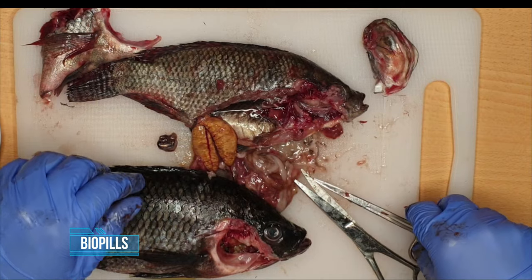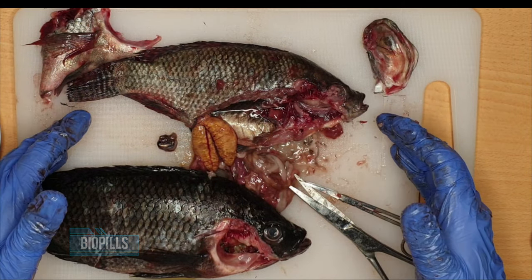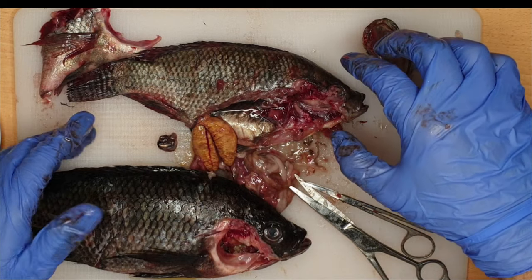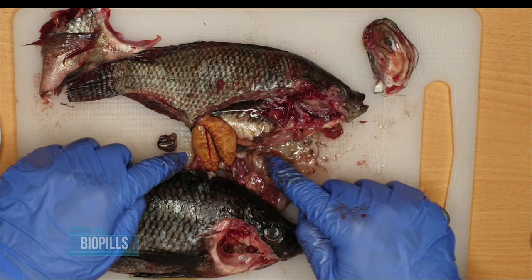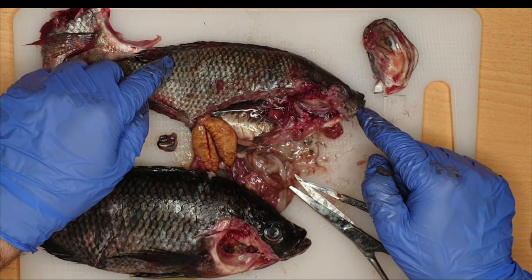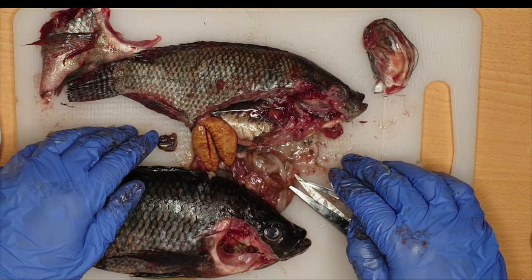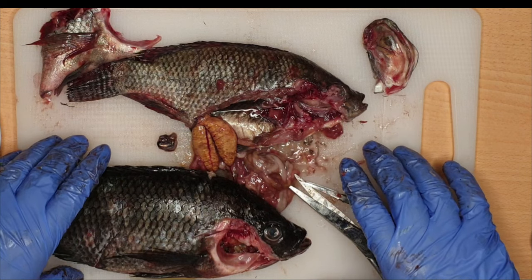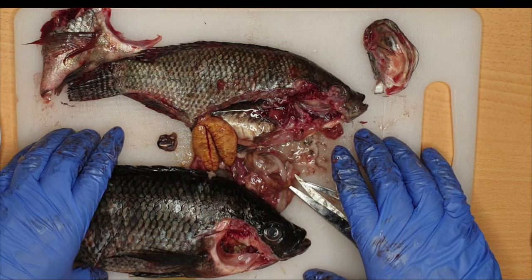So today we covered the general structure of the bony fish: the head region, the trunk region, the tail region. We went through the internal viscera of the bony fish and dissected the eye. I hope this was an illustrative and comprehensive anatomy and dissection of the fish.